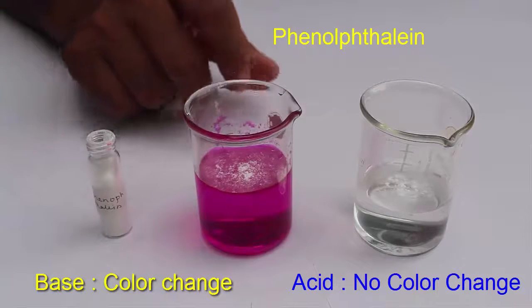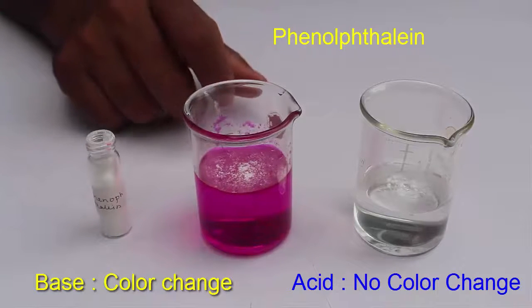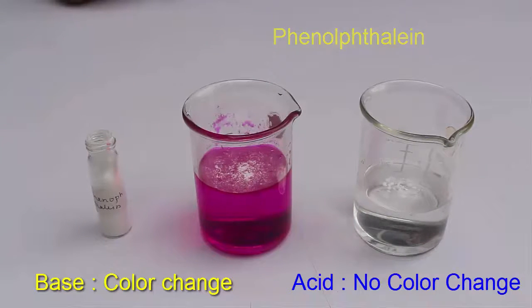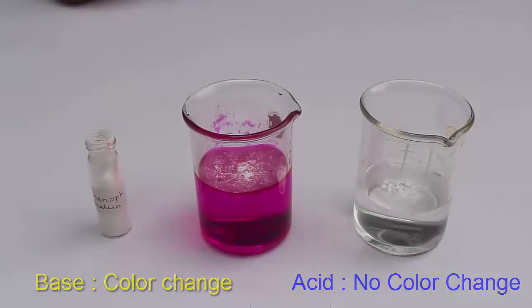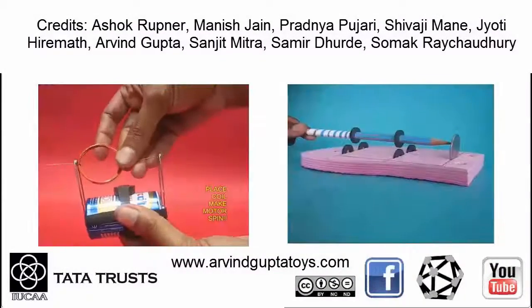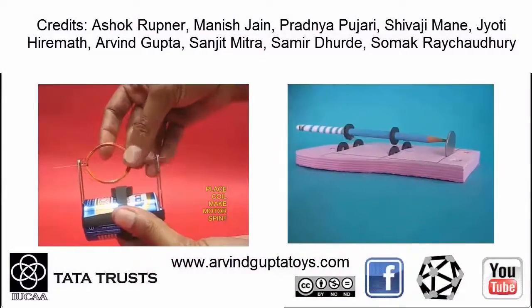So we can conclude that acid does not change color, but a base becomes pink when phenolphthalein is added.